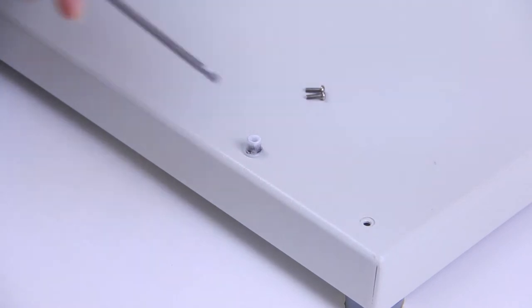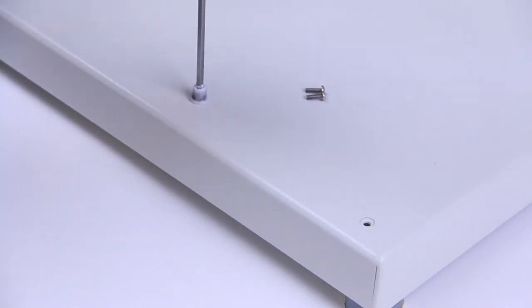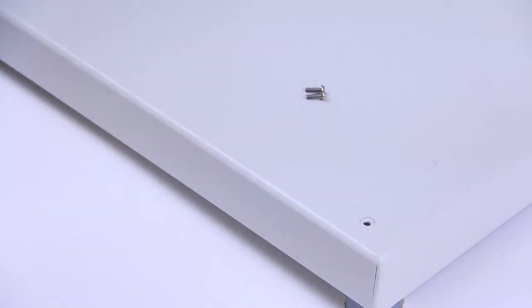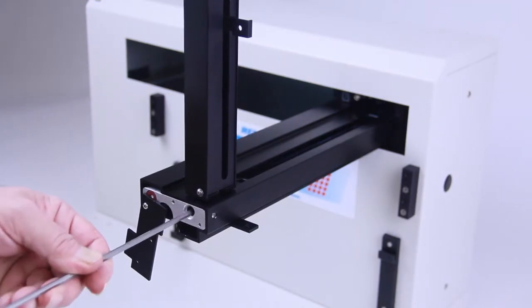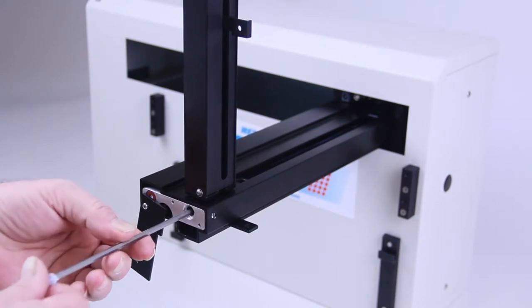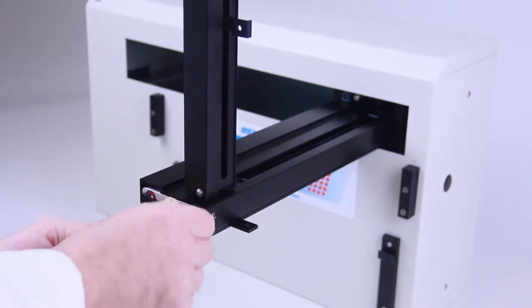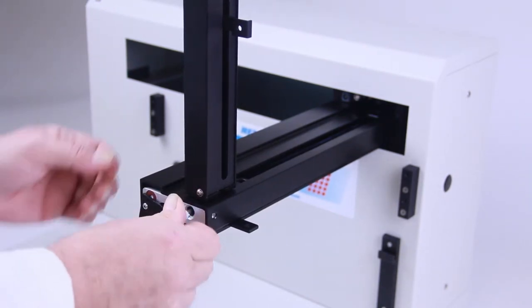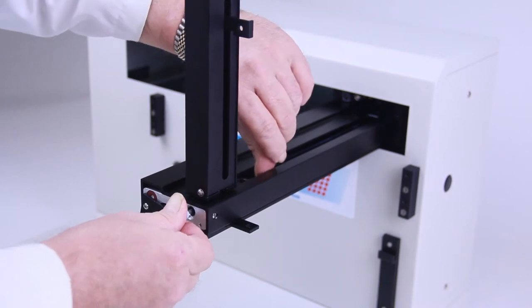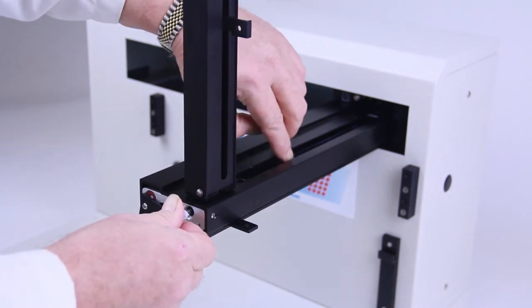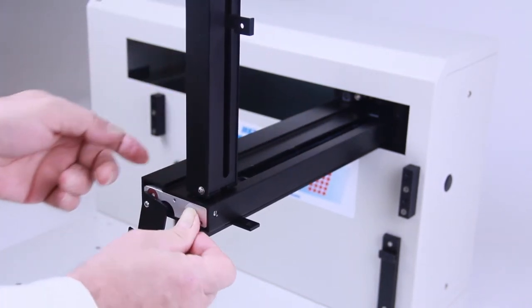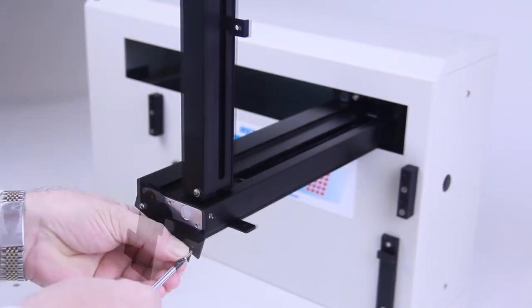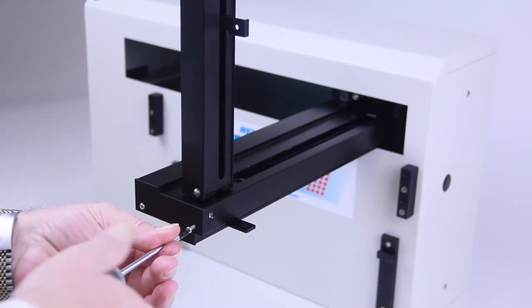Reinsert the control rod as far as it will go. You may need to rotate it back and forth slightly to get it to pass through the gearing and motor drive socket in the horizontal slider. Reinsert the plastic plug. Reattach the cover plate to the front of the horizontal arm.